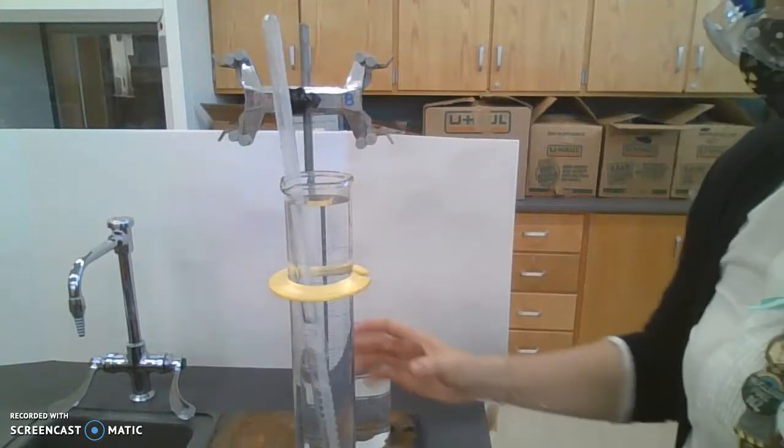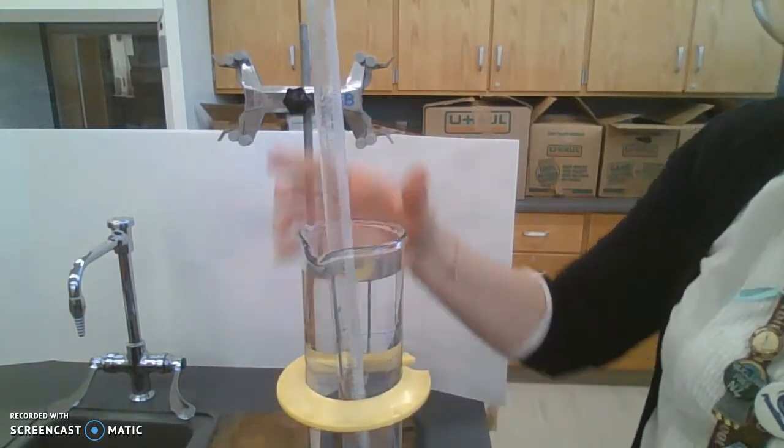Okay. And I will move this a little bit closer so you can see the water levels.